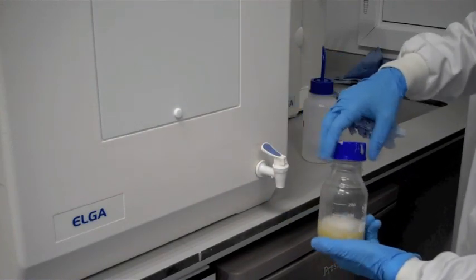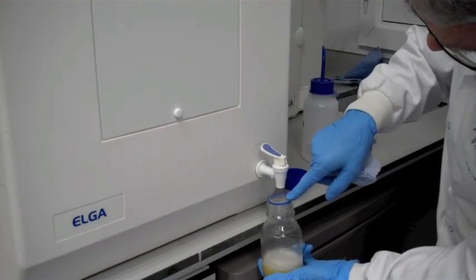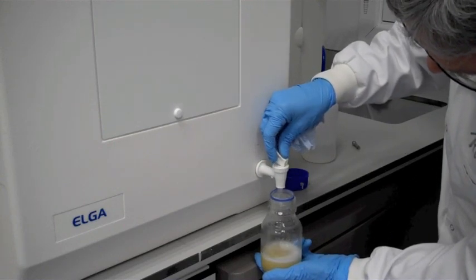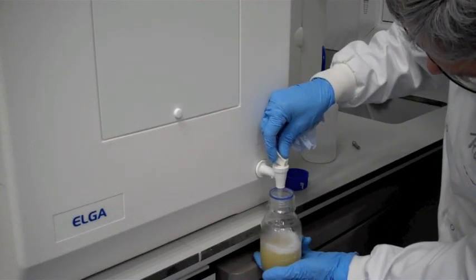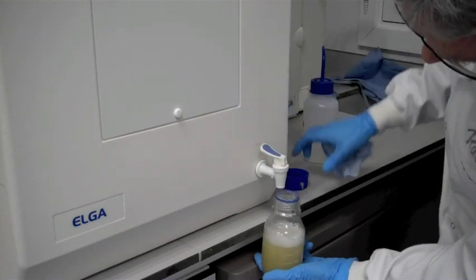Then simply take the top off again. And don't place the lid against the nozzle. Leave a little gap and fill until you hit the 200 milliliter mark. Don't bother about the froth, just the liquid. There you go.